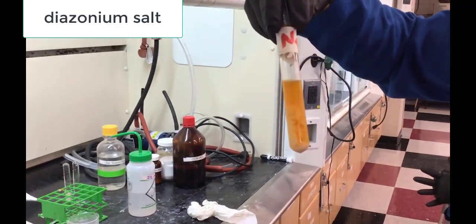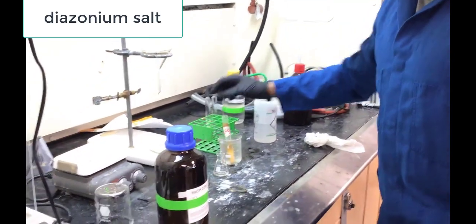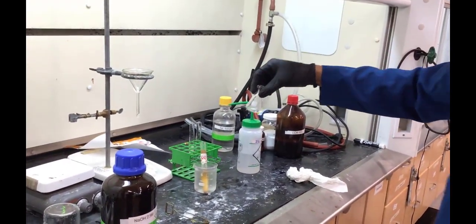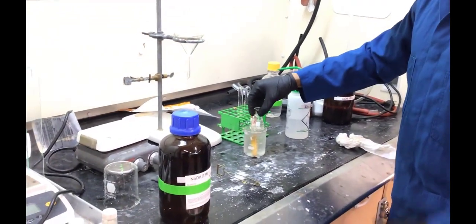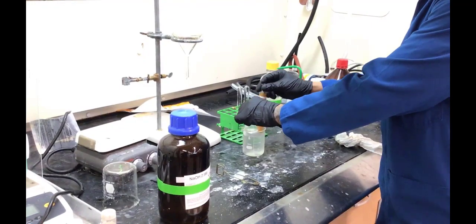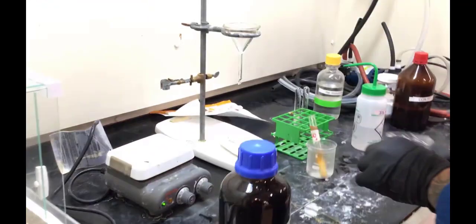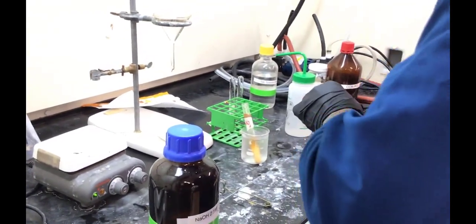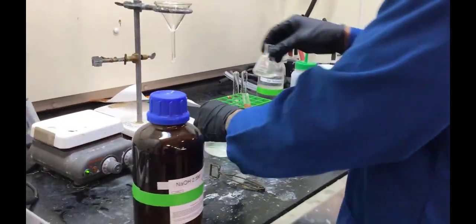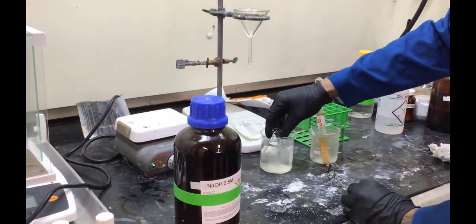So there is your diazonium salt. All right, you could see a nice precipitate in there. All right, and so there is the salicylic acid and sodium hydroxide in the Erlenmeyer. It won't fit in that beaker, so they're going to get a separate beaker for an ice bath. All right, so both are in an ice bath now.